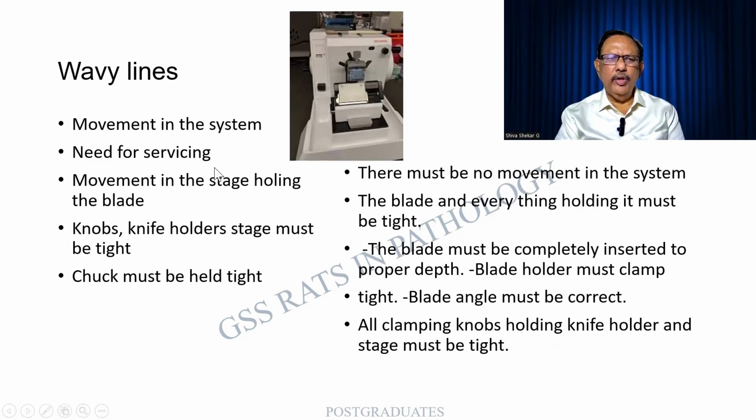The wavy lines we had already mentioned. This can be because, see, these are all the screws over here which fix the block, and then there is a knife holder almost similar to a microtome. All these should be very tightly fixed. So any movement in the system, any vibration will show. And if the instrument itself is not proper, it needs servicing. And there can be a holing in the blade. Knobs, knife holders, stage, everything must be checked and should be tight. So these are all the things.